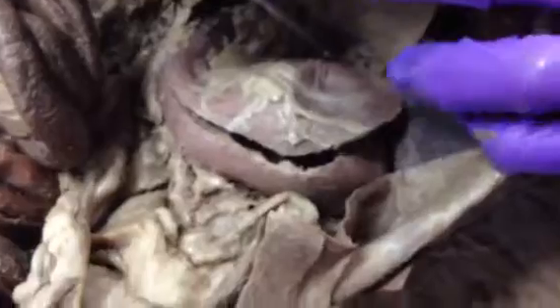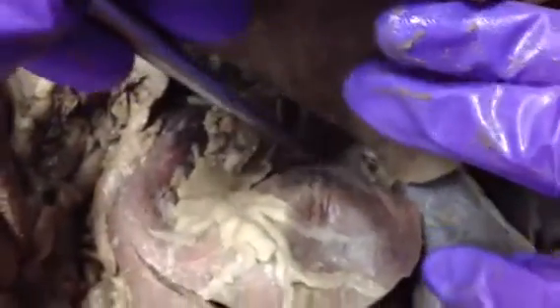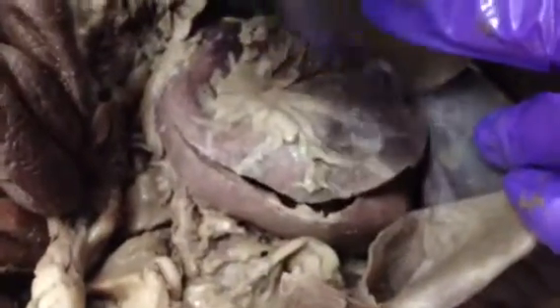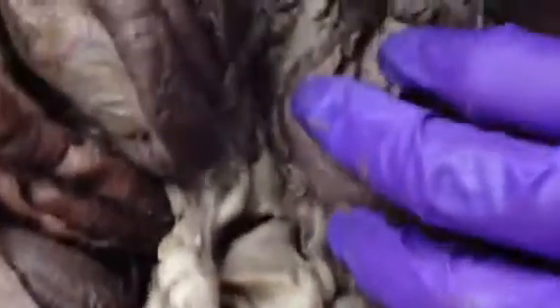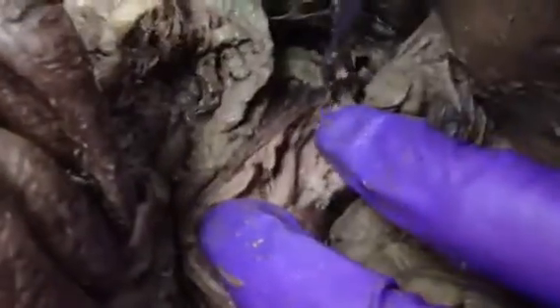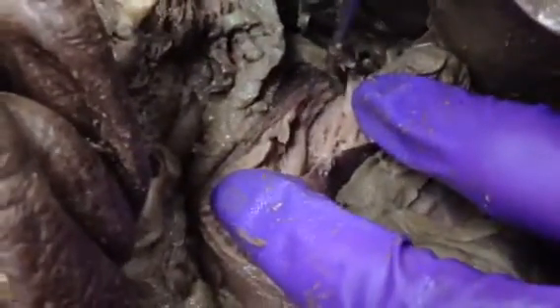Whenever you're looking at the stomach, which is right here, the more cranial part of the stomach that comes right after the esophagus is the cardiac region. The curving part right here is the fundus. The bulk of it is the gastric body. And then this is the pyloric region. And then when you look inside, you can see the gastric folds. And then the pyloric sphincter is in the pyloric region here, and it's really muscular.